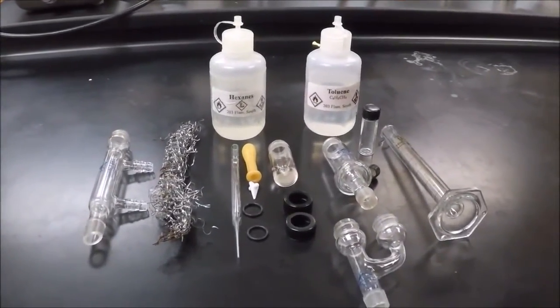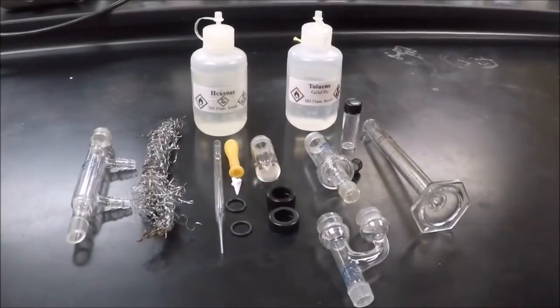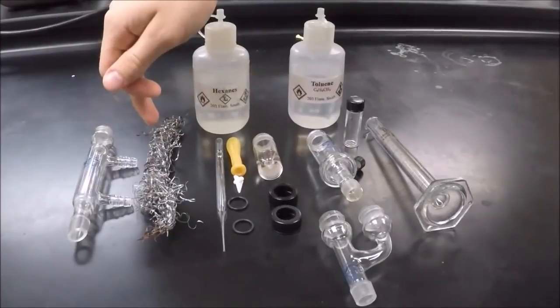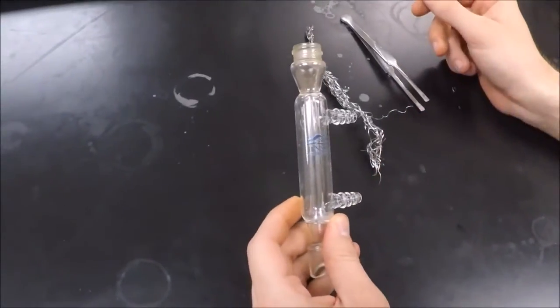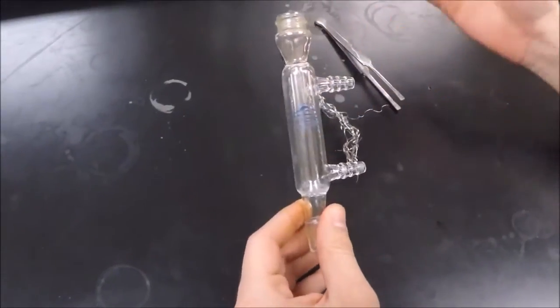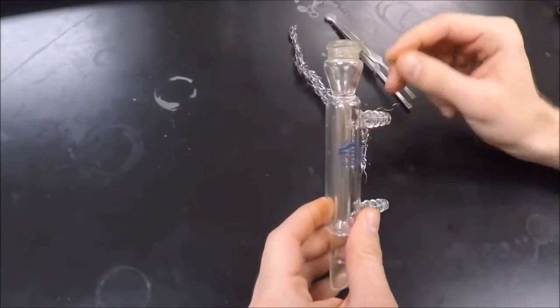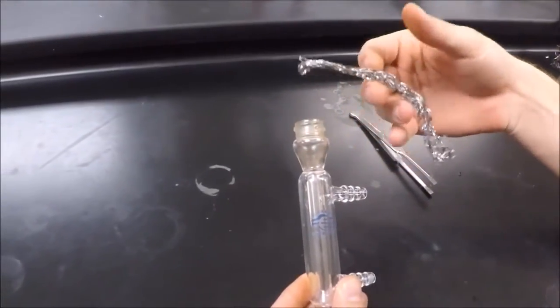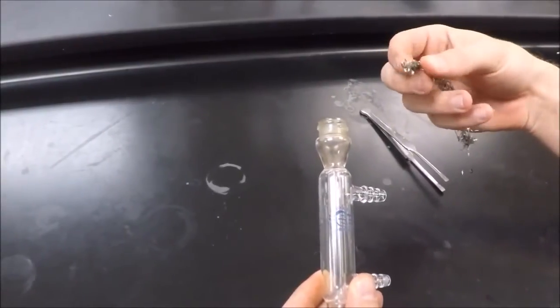Now we're going to be doing a fractional distillation. Everything is the same as a simple distillation, except now we're going to be adding a reflux condenser with steel wool inside it. After doing your simple distillation, don't clean your glassware with water or acetone or that will mess up your product. Take some steel sponge and put it into your reflux condenser — you don't need a lot, because if you have too much, your vapor can get trapped in the steel sponge.